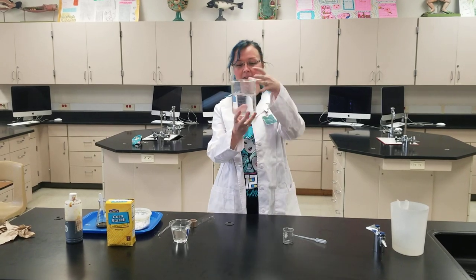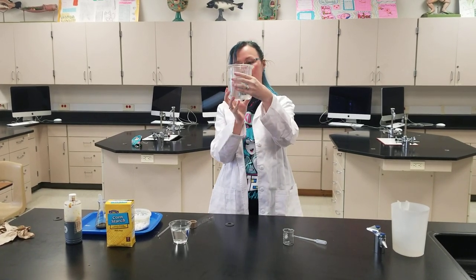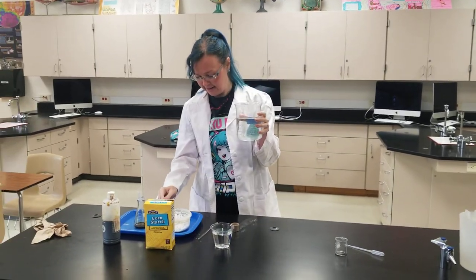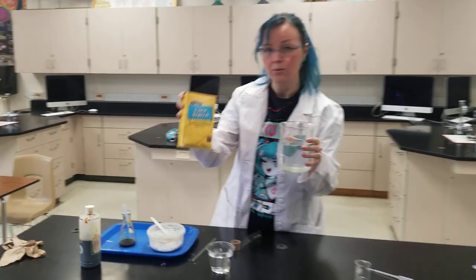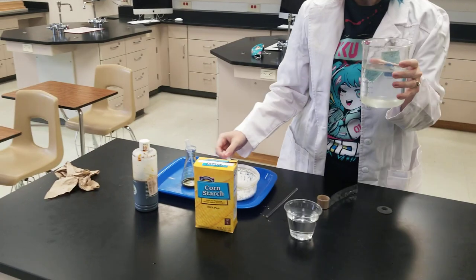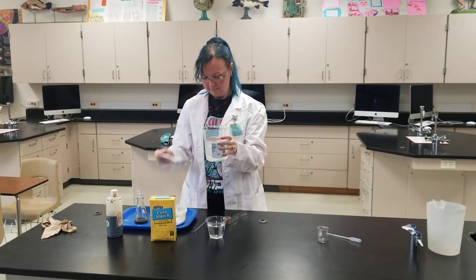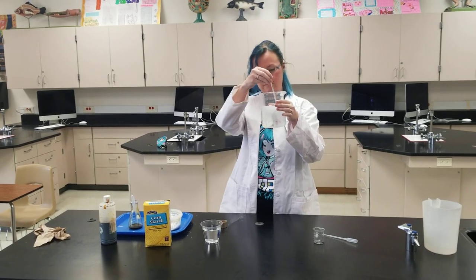So inside of this beaker, I just have plain old water. And to this, I'm going to add some different components. So the first thing I'm going to add is just some regular old cornstarch. I'm going to add this in there, then I'm going to mix it up.